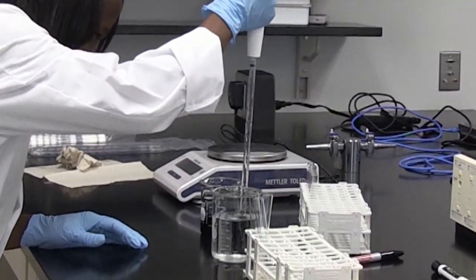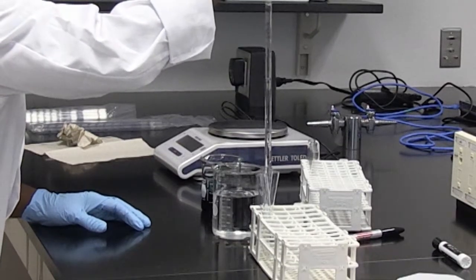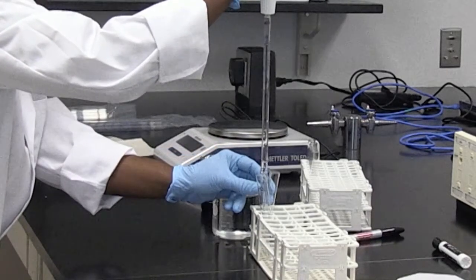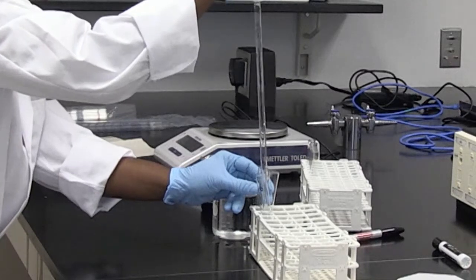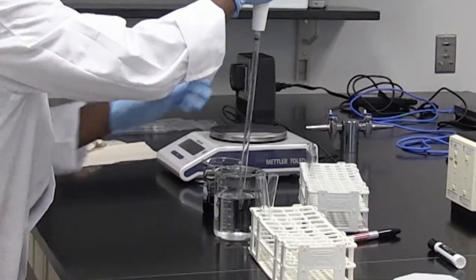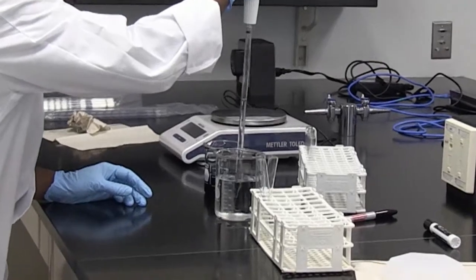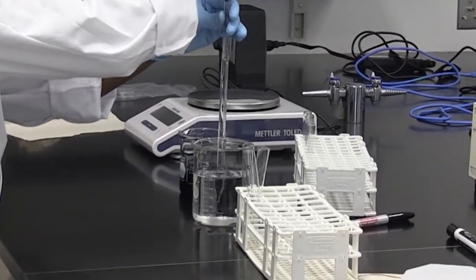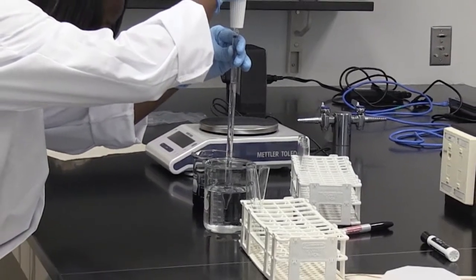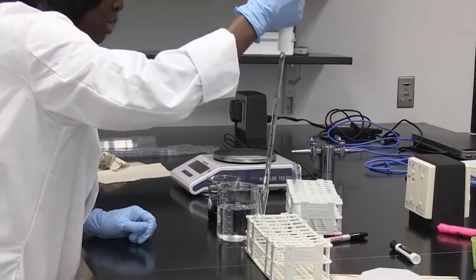For those who need to know how to use a pipette, see the previous video that was done on this. The first test tube has 9 ml of water. The second test tube is going to have 9.8 ml of water. Our serological pipette has increments that will allow you to measure 9.8 ml. We add that to the next test tube.